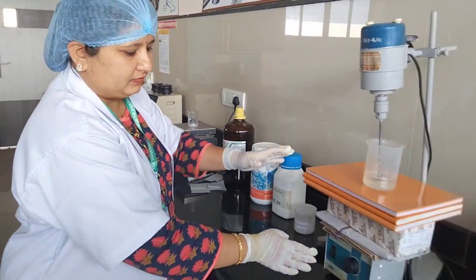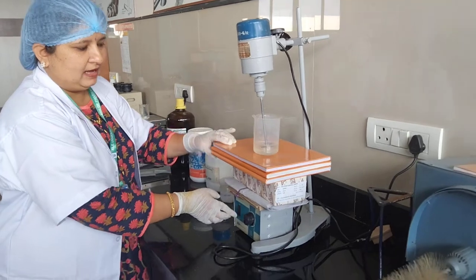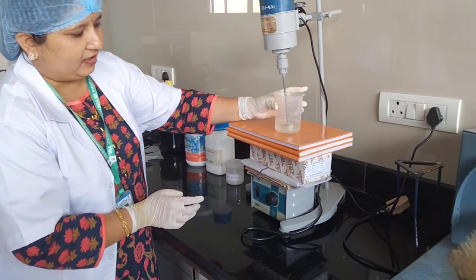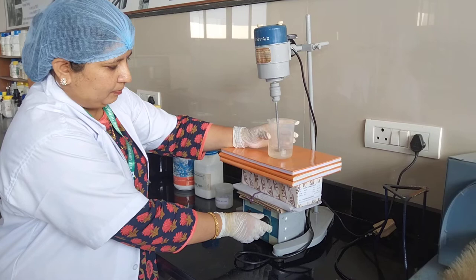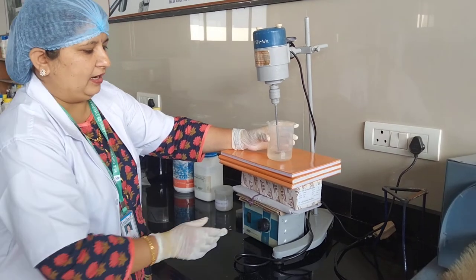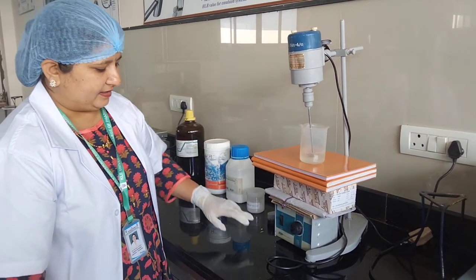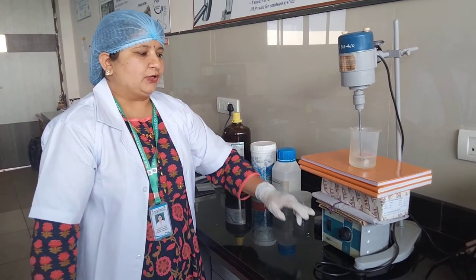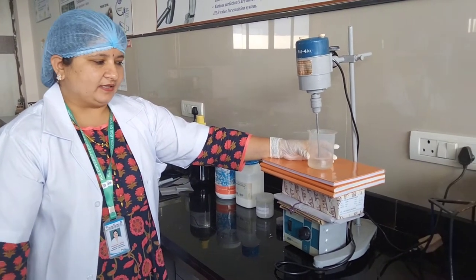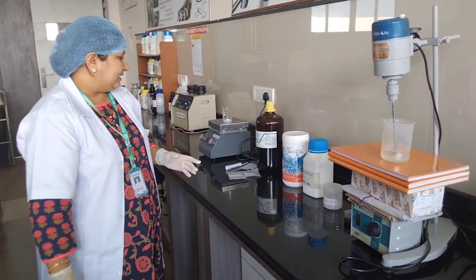Now moving forward, a propeller has been installed. I have taken around 100 ml of glycerol in a beaker and set the stirrer on at a particular speed. When the glycerol is being stirred at the set speed and the acetone has already dissolved the polymer and the drug, we stop the magnetic stirrer.